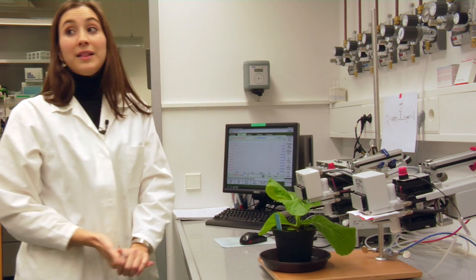And then I close the light source. Very well. Now I'm going to let it stabilize for a while and I'm going to explain how it works.